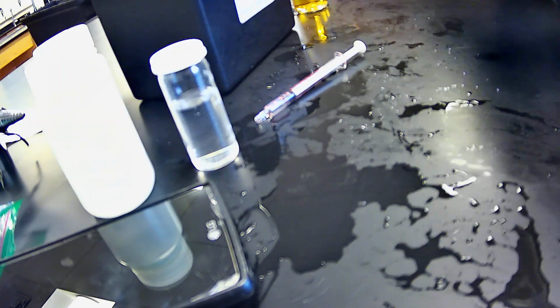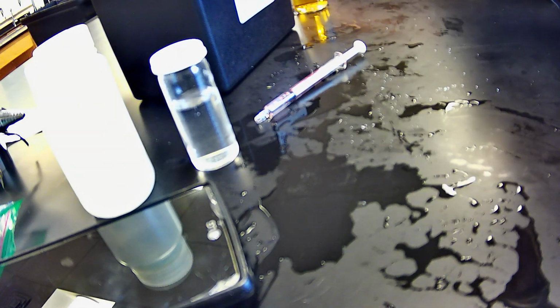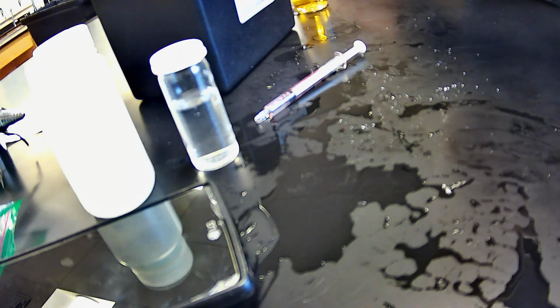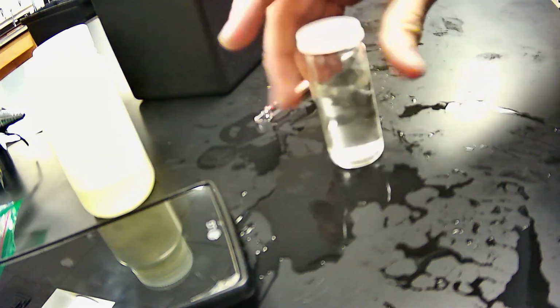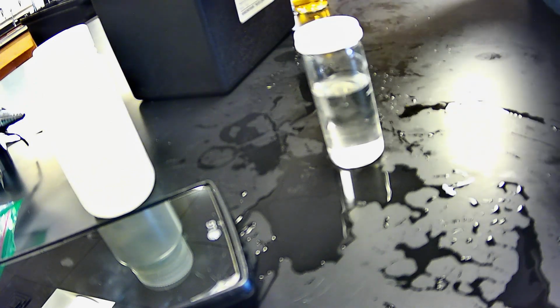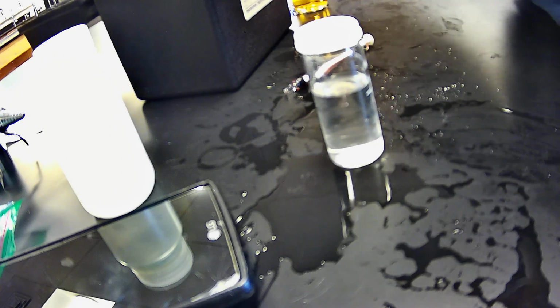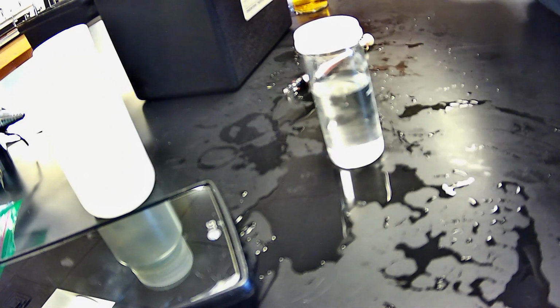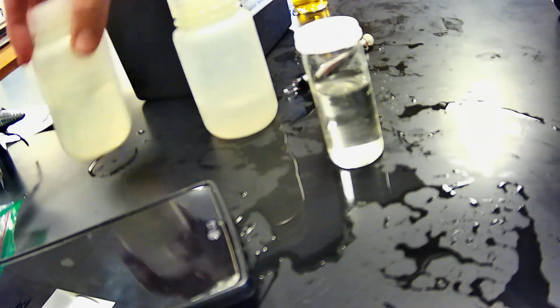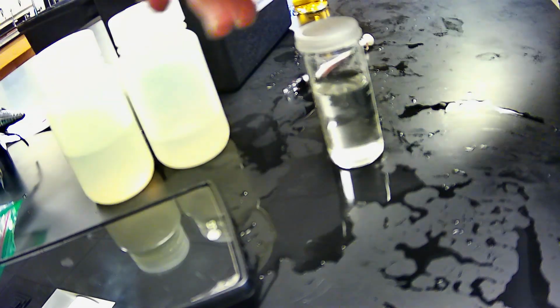So I think in this example you can see a difference between Winkler and the official chemical test, as well as a difference in the sample tests. They'll get you into the ballpark, and like I said, there could be some error because I didn't submerge them. I used these samples that I gathered.